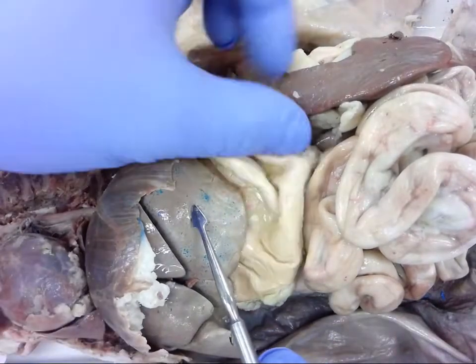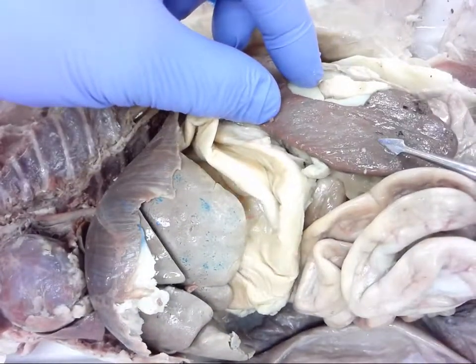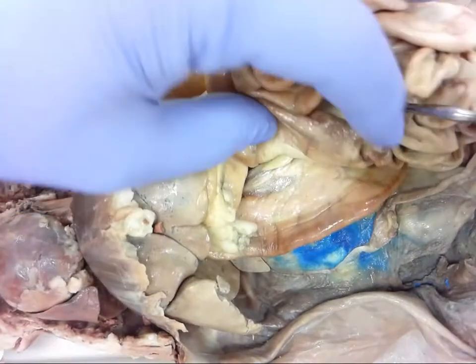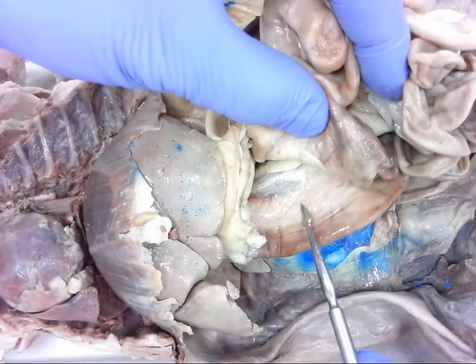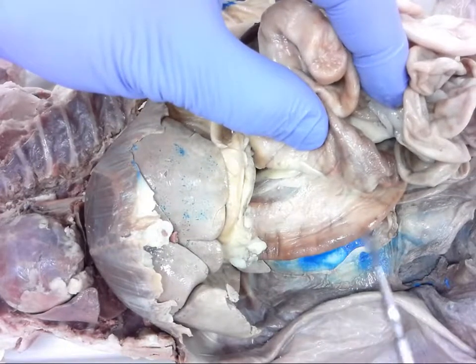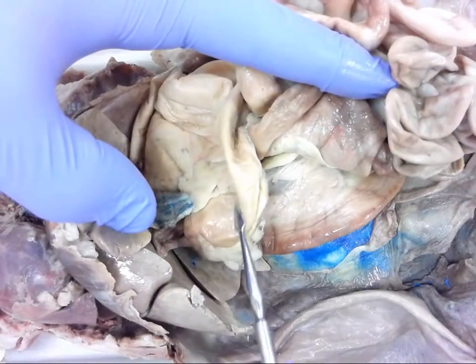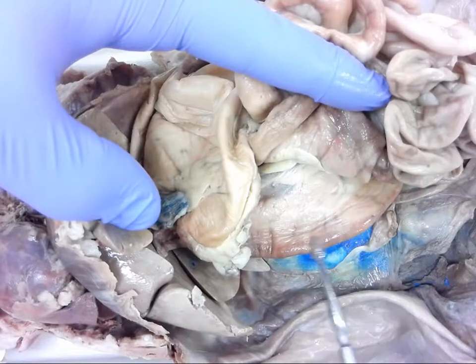Number four. Give me a moment to find — this is number five, that runs along number six. I can get a little better view here of the area. This is number five, and here is number six.